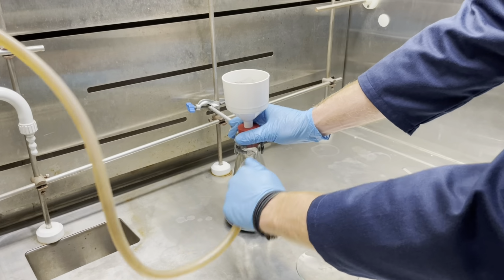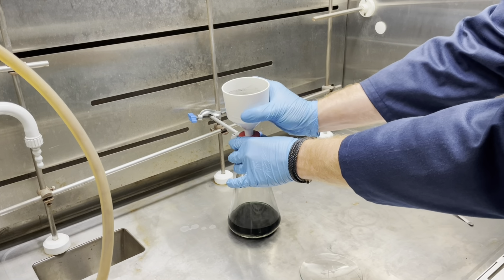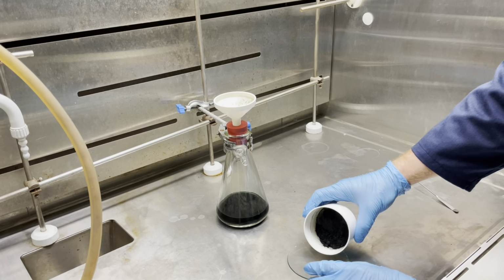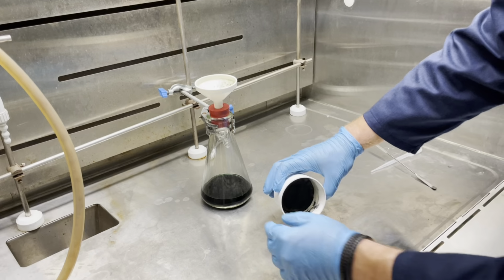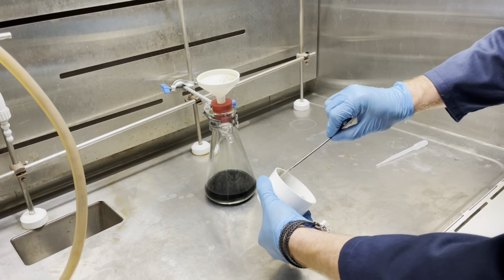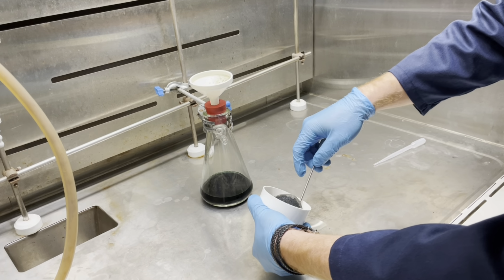Disconnect your Buchner funnel from the vacuum, ensuring that the vacuum tap has been closed, and then transfer your product to a watch glass so that we may place it in the oven. You can use a spatula or slightly try and tip your product into the watch glass first, which will usually result in you using the spatula in the end.